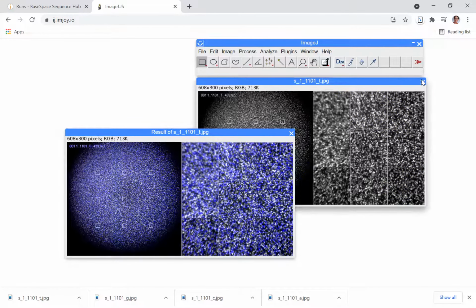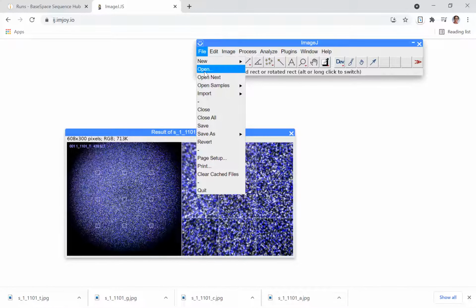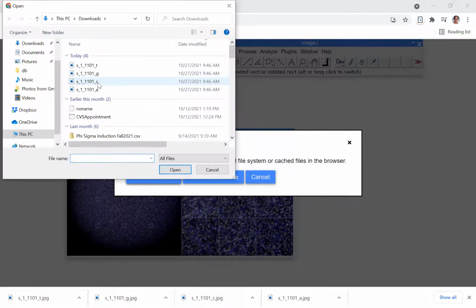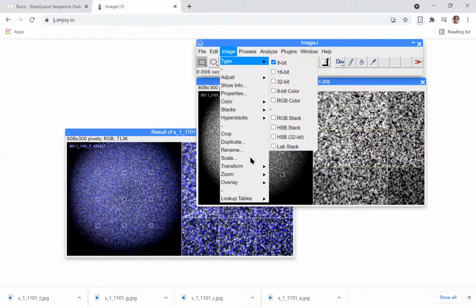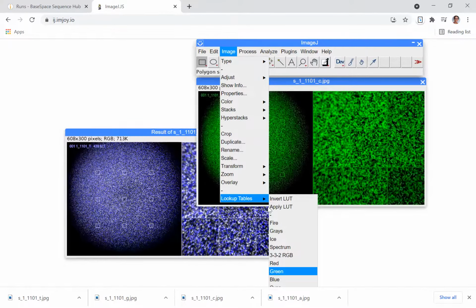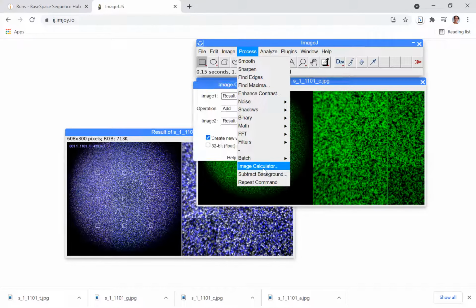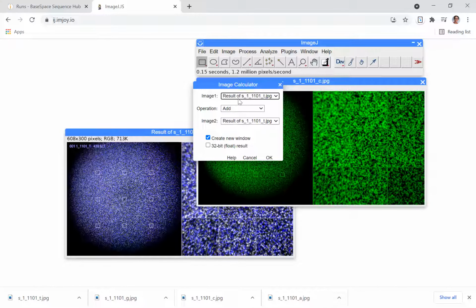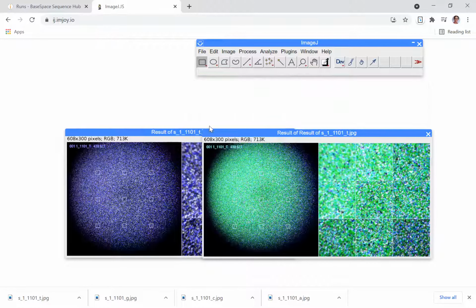I'm going to close both of the G and the T files. And now I'm going to open up the next channel. File, open, select local file, get the C image, change it to 8-bit to get rid of the yellow lines, go to image lookup table so that I can false color the image green, go to image type RGB color so that I can combine it with the other images, and process Image Calculator. I'm going to take the image of T and G combined and combine it with C.